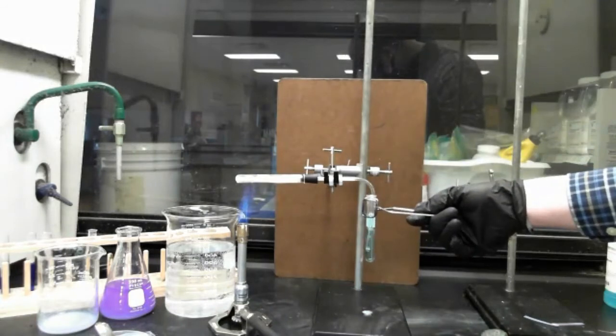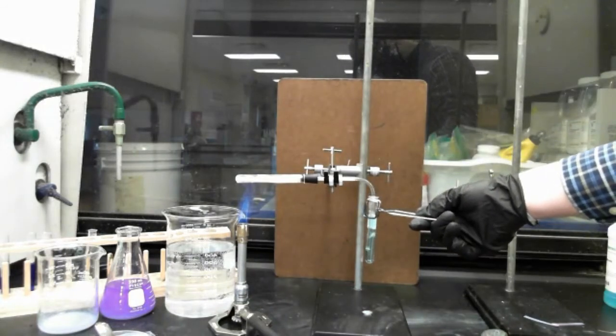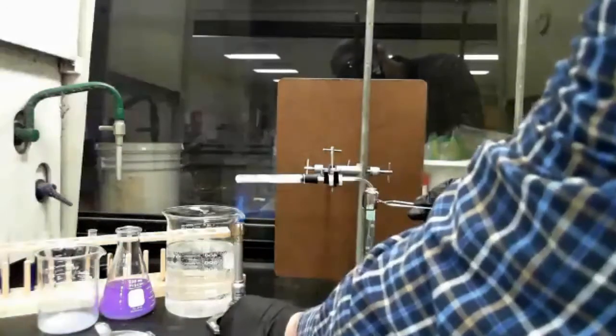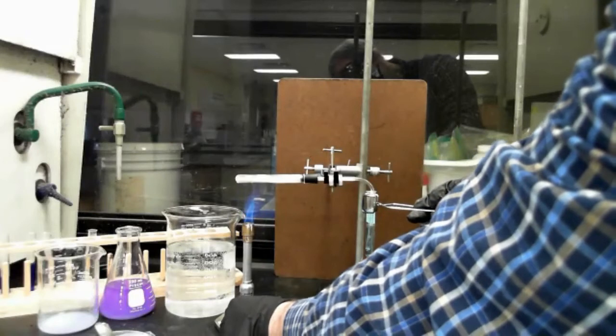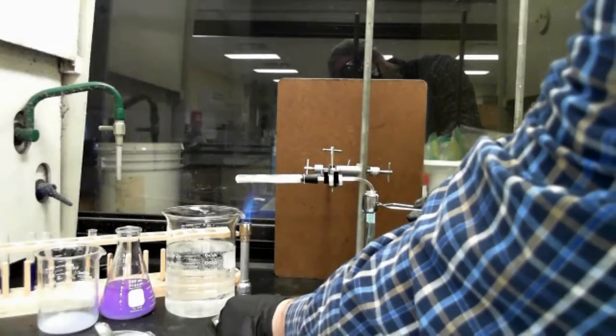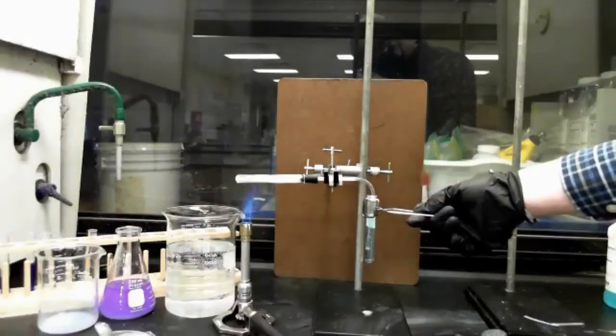So I'm bubbling some ammonia in here. Now, one of the issues we've had with this is that eventually the bubbling stops and the solution gets sucked back into the other test tube for reasons unknown at this point.